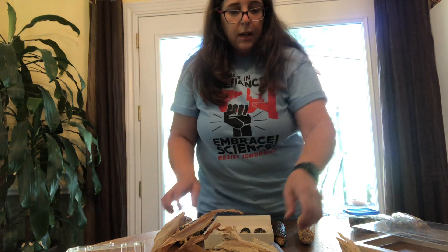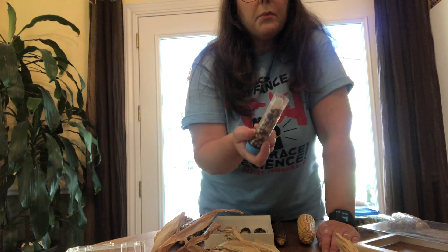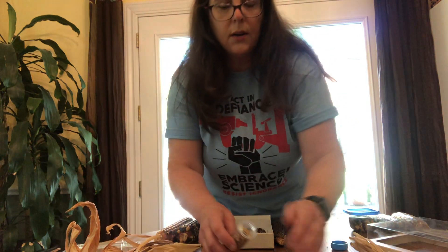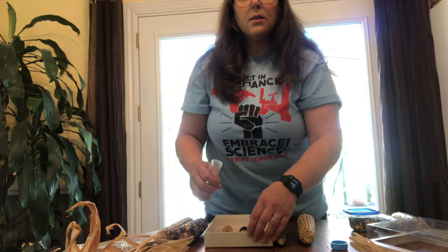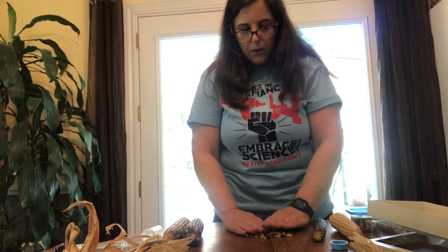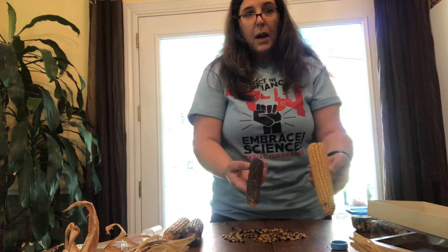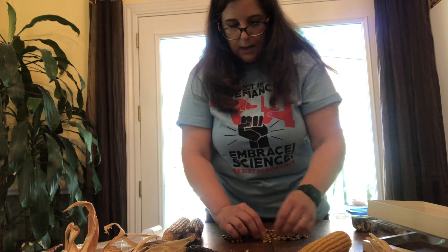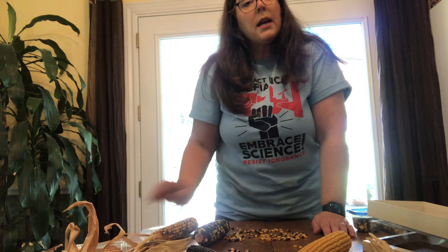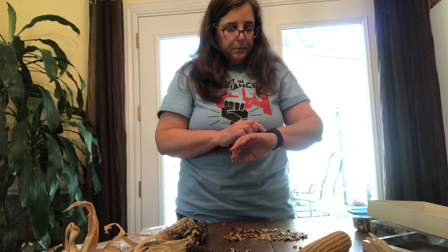In the first experiment for the monohybrid cross, you would take your sample — I have a sample for all groups. The procedure is basically taking the kernels, sorting them according to whether they are pigmented or non-pigmented, and using the parents as a guide to help count them. I'm not going to make you watch me count all these kernels, so I'll count them for you and then we'll move on to the next segment, which is the dihybrid cross.